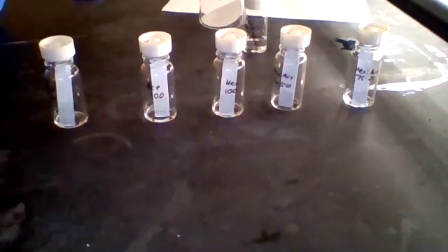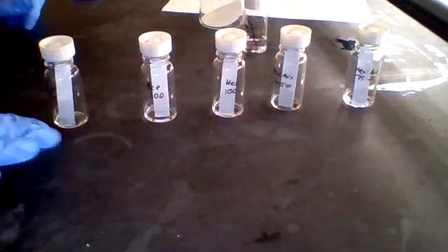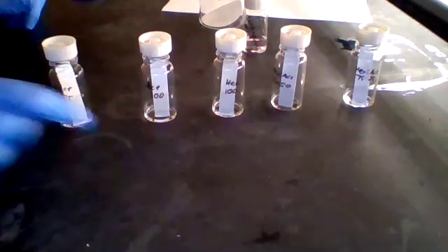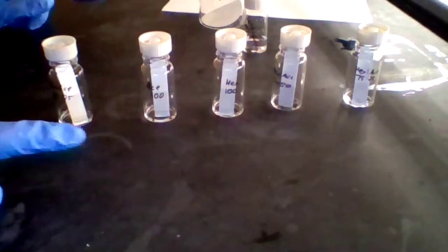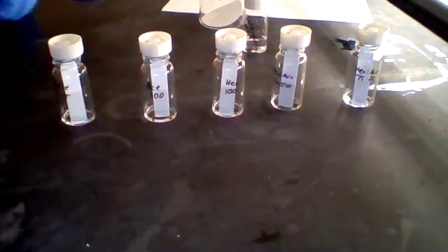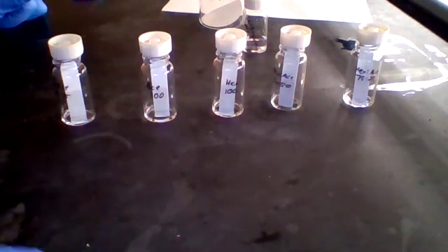All right, so we have our plates in our solvent chambers. They're currently running. You can see the solvent moving up the TLC plate in each vial. These are the different solvent combinations. So we have 25% hexane, 75% acetone, 100% acetone, 100% hexanes, 50-50, and then 75% hexanes, 25% acetone. And ideally, the spots are going to move up different distances up the TLC plate due to the different solvent polarities that are actually in the solvent chambers.